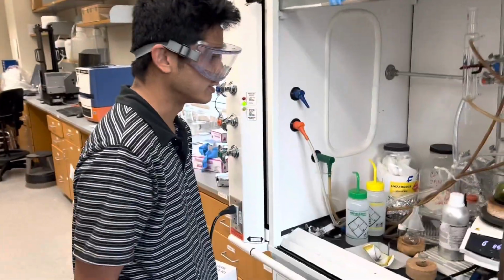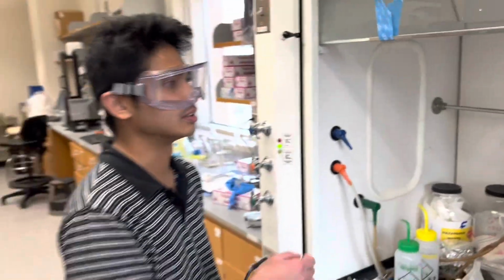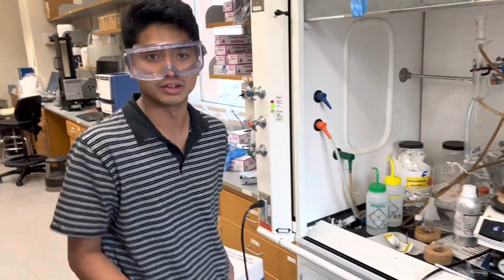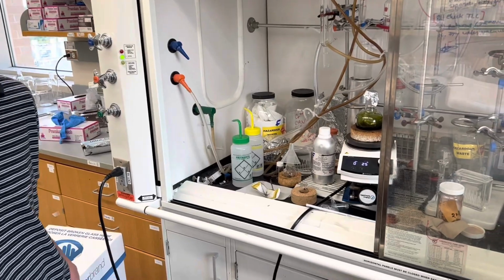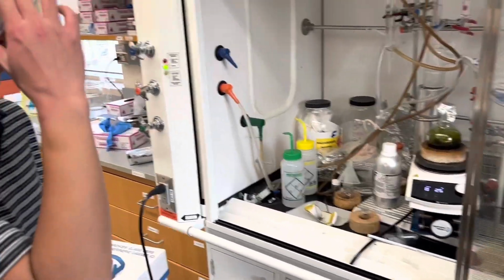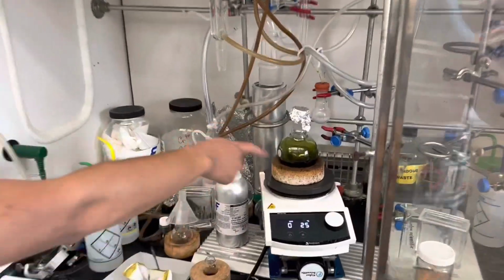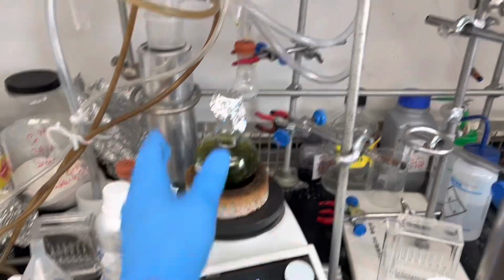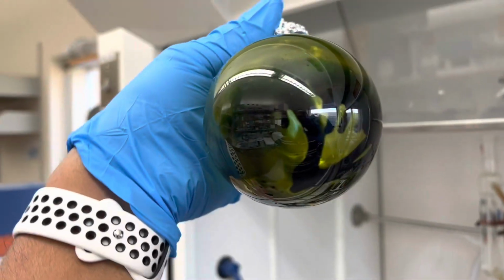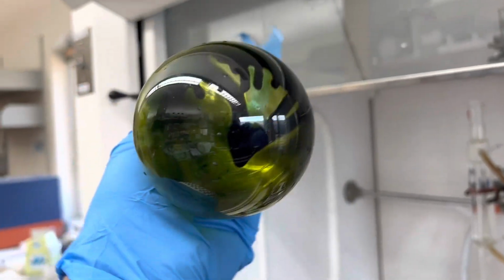Mashallah, how do I deal with this? The literature told me that for this reaction, I should get a solid. So I could filter it out, get a precipitate, and dry that down. But the filter paper didn't seem to have much solid, so I concentrated the mother liquor down using the rotavap, and now you can see it's kind of an oily, slick, gummy liquid. I feel like this is my true product right there, and it's just odd. I thought I would get more of a powdery solid.